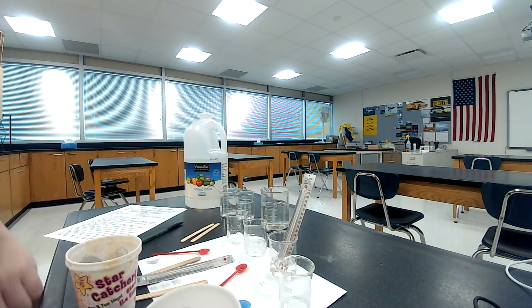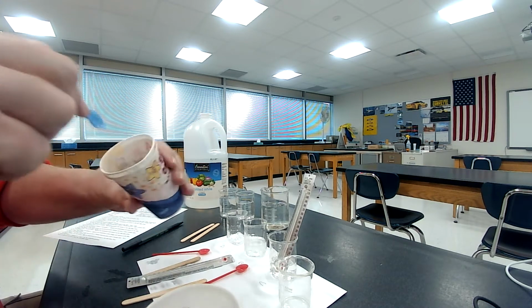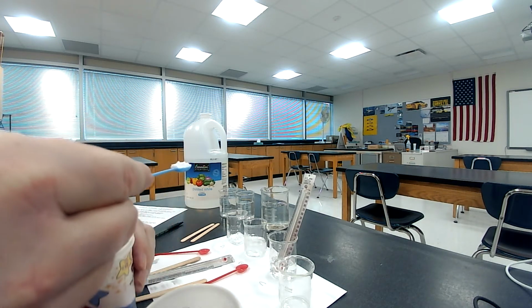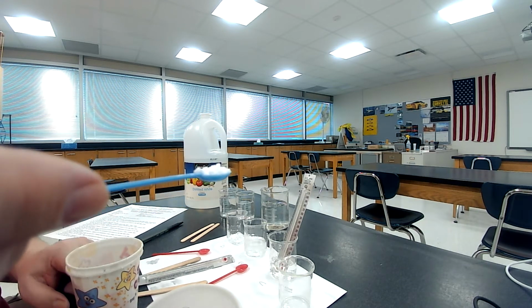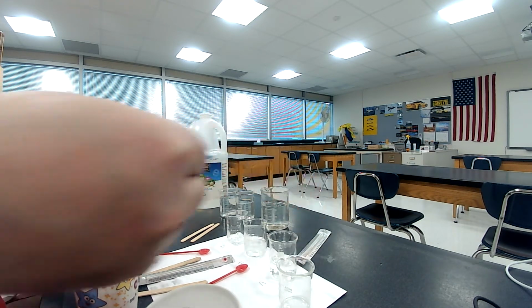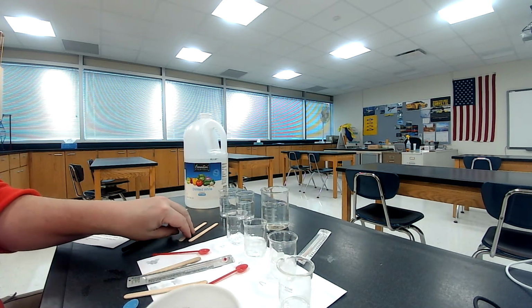Using a small plastic spoon, scoop 1 spoonful of calcium chloride and put it into beaker C. So I'm taking my little scooper and getting a nice level scooper full. This scoop is so small that I don't really need to level it off because it's pretty level, just like that. Okay, now it says to put it into C. Okay, we got it into C with calcium chloride there.